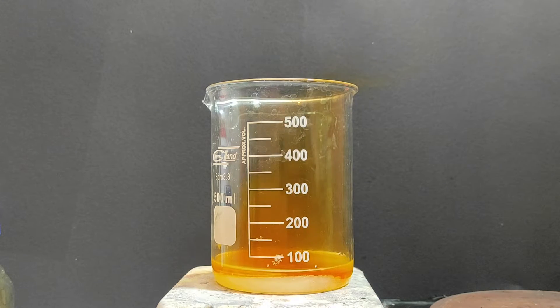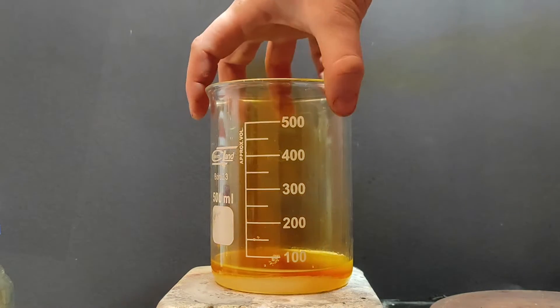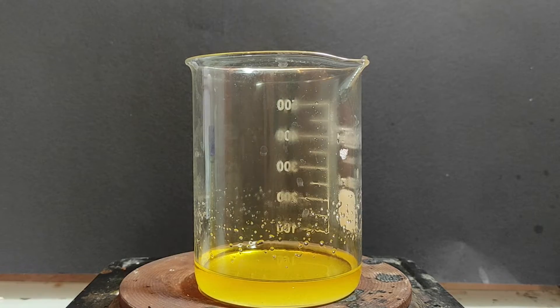This is everything that we need for the creation of oxalic acid and all we have to do is just heat it up. So I've transferred the beaker onto my hot plate and I've turned on the heating.